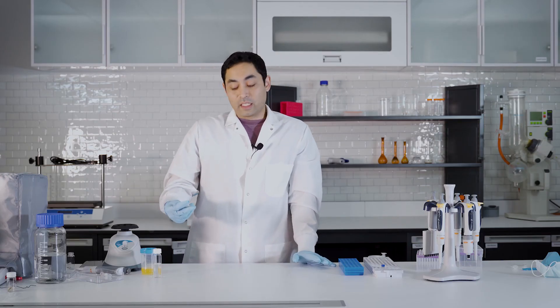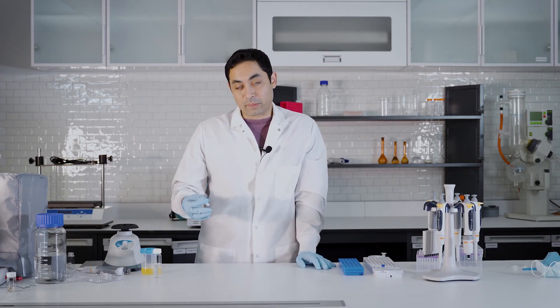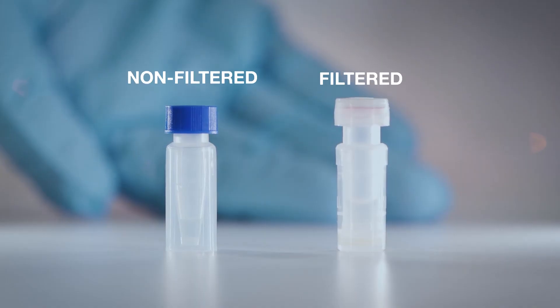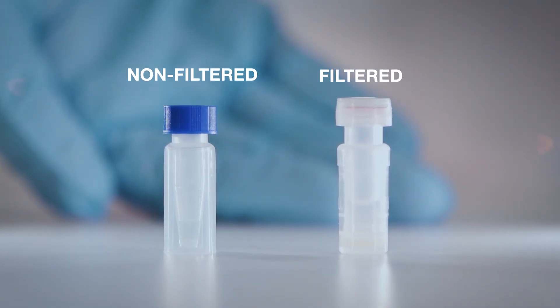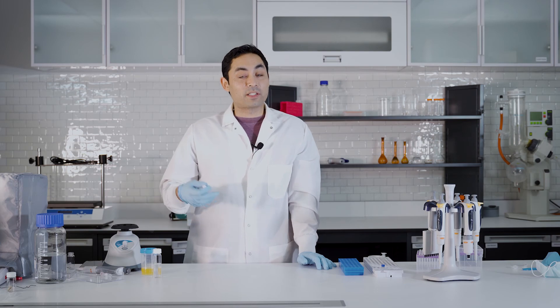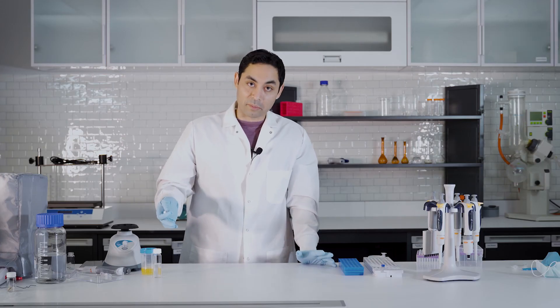Now this sample is actually a bit cleaner because not only did you do the protein precipitation but you also filtered the sample as well. And because you didn't have too much sample you can't really get it in a syringe filter or something like that because you lose all your sample in the filter.